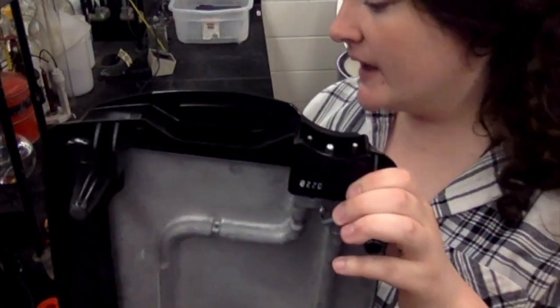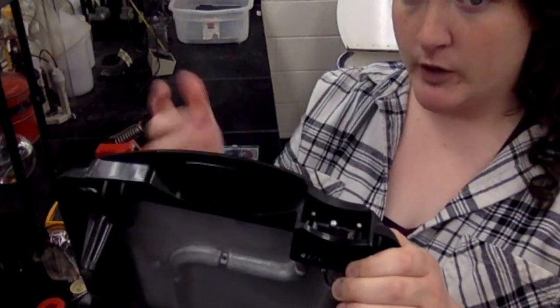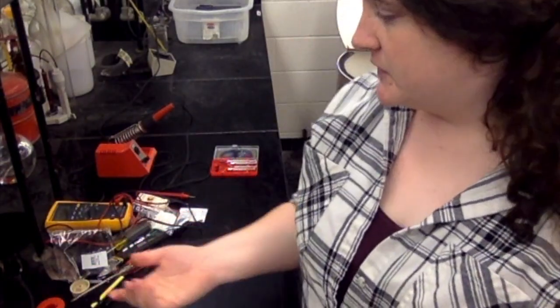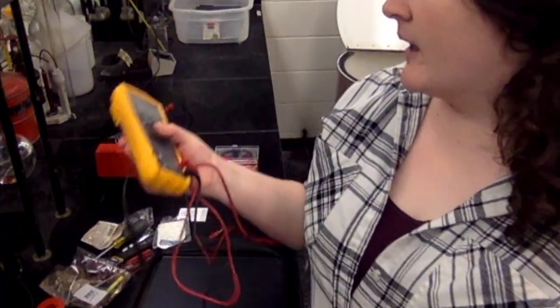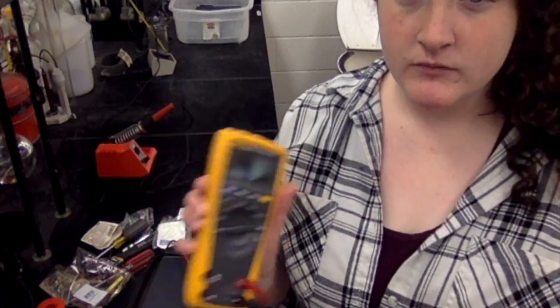So once you've done that, then you can plug everything in. So the stock controller is going to go back in where you would normally plug it in. Then the end of the stock controller is going to be plugged into the 2-gang outlet. And yeah, the last thing to do will be to set the dimmer switch. So you can use a voltage reader, and you're going to want to set that to 67 volts. And that's how you do all the modifications.